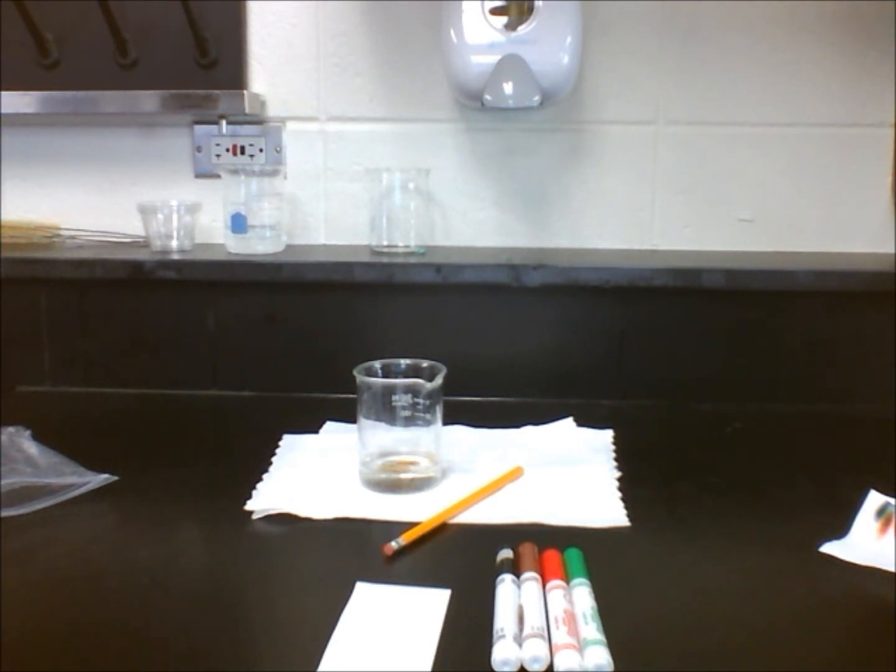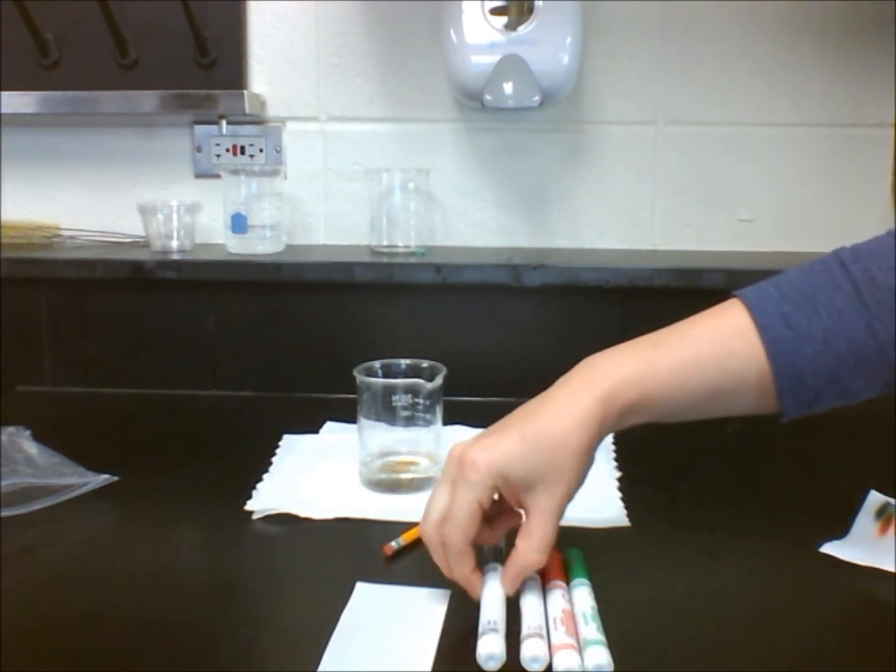Before actually conducting the experiment, we must come up with a detailed procedure describing the exact steps we need to take in order to make a fair comparison.